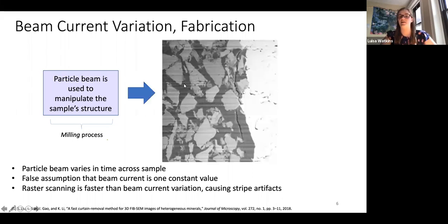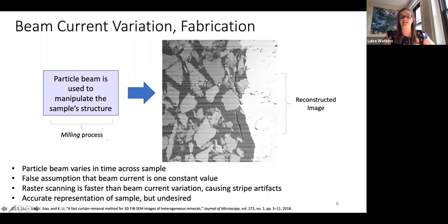So this is an example of that, where we still have these stripes, but in this case, this actually is an accurate representation of what the sample actually looks like. But we don't want to have these stripes. If we're trying to manipulate the sample in a specific way, but the beam current is not what we want it to be, we could be doing a lot more than we want. If the dose is higher than we think it is, then this can have these striped effects. So these are obviously very undesired. We don't want to have these stripes.